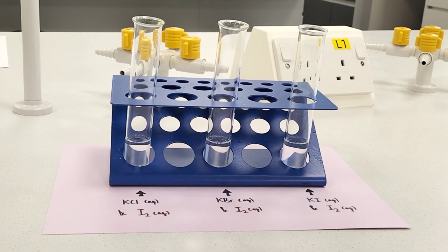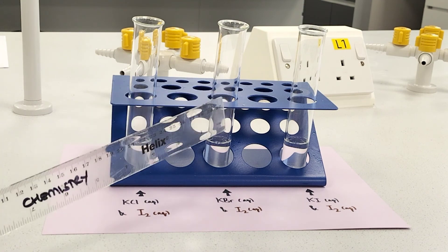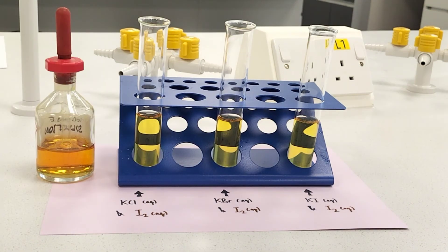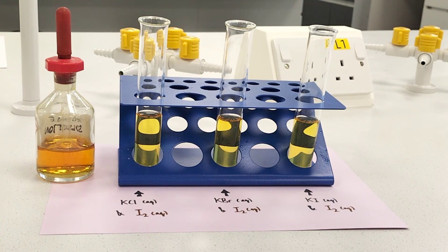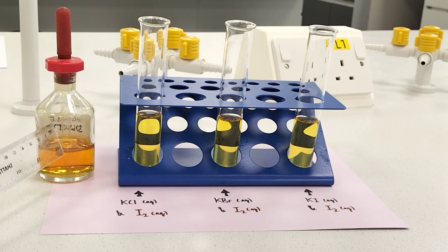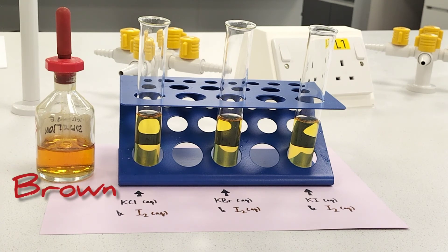The final stage is to prove that iodine is the least reactive of the three halogens investigated. We take boiling tubes of potassium chloride, potassium bromide, and potassium iodide and add iodine water to each, looking for colour changes. The original iodine water solution is more orange, but ideally it would be more concentrated and brown — in exams it is better to say it was brown rather than orange.